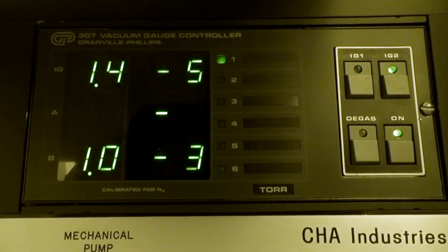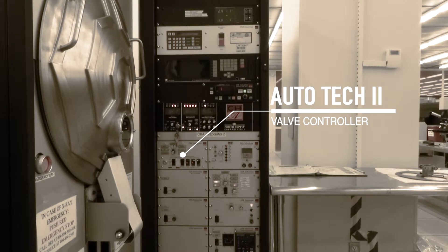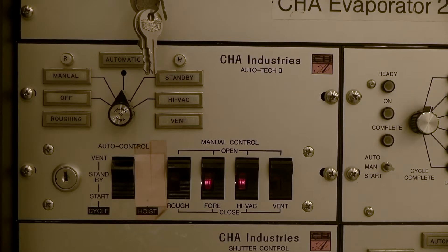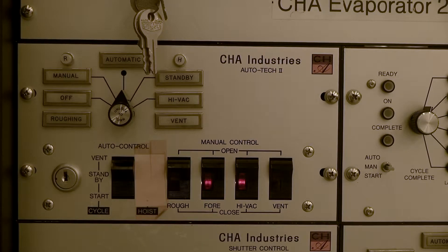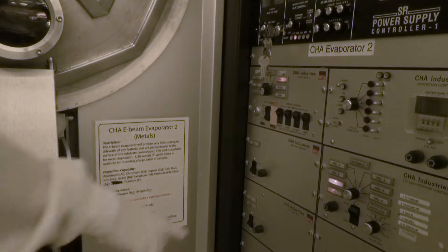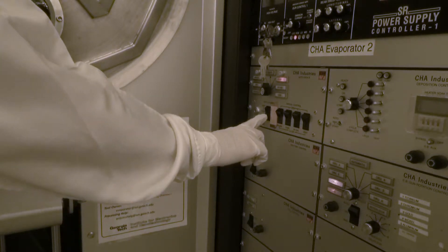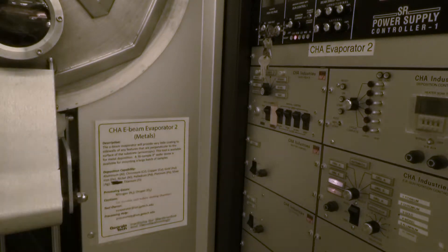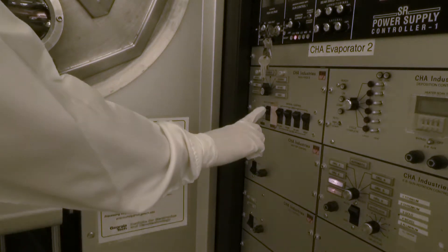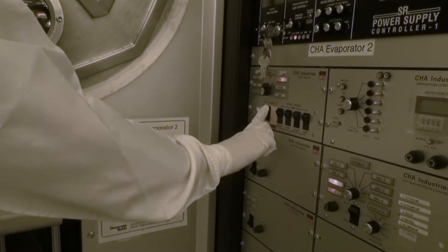The Autotech II valve controller controls the valves that are used to control the vacuum pressure. The rocker switch has three positions: the down position is for pumping down, the middle position is for standby, and the up position is for venting.